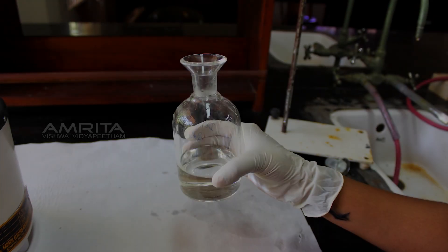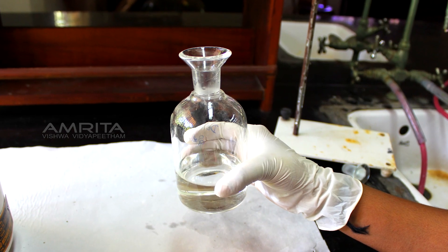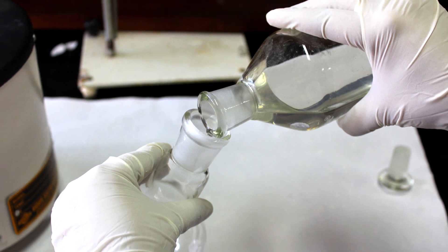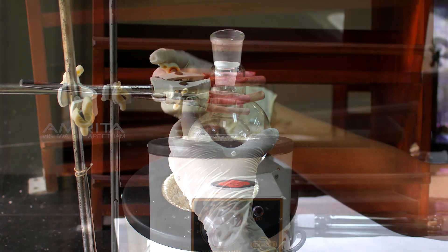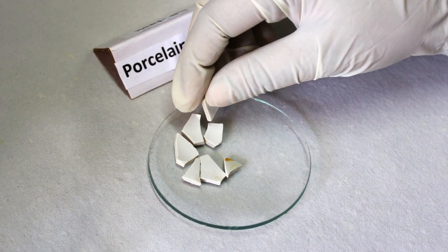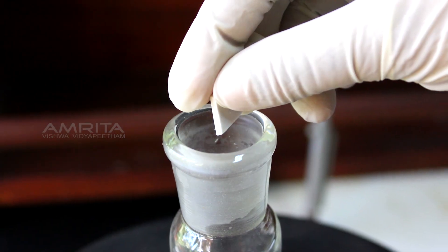Procedure: Take a mixture of acetone and distilled water and pour it into a 250ml RB flask. Clamp the RB flask to a stand and place it in a heating mantle. Take some porcelain chips and put them into the RB flask.